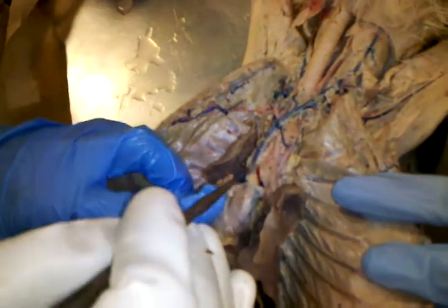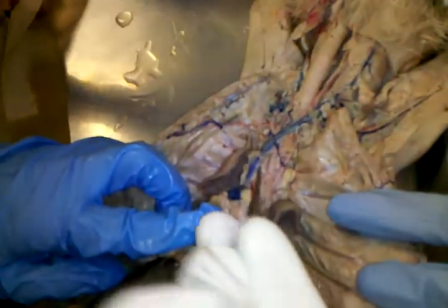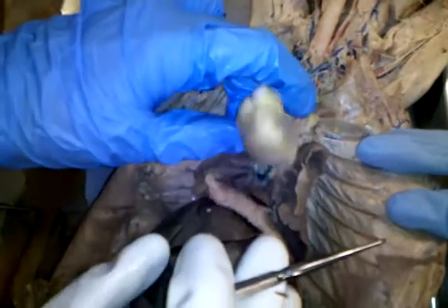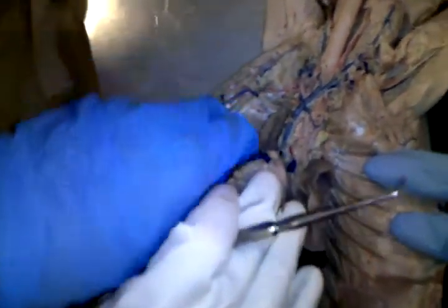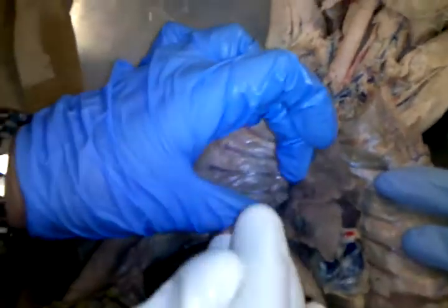That's okay. All right, for the veins, you have the superior vena cava here that empties into the atrium on the side, okay? You've got the inferior vena cava right there, okay, inferior vena cava. And then there's one other real big one, and you'll have to pull out the vein picture to see it. There's one that dumps into the superior vena cava.